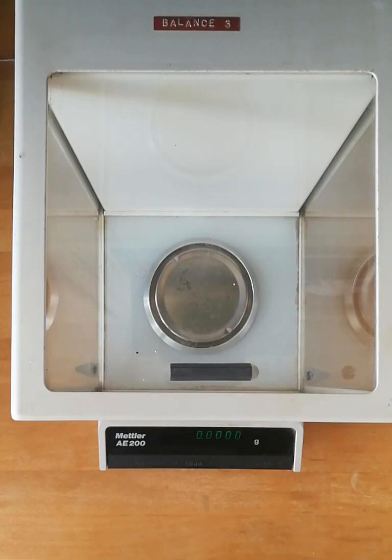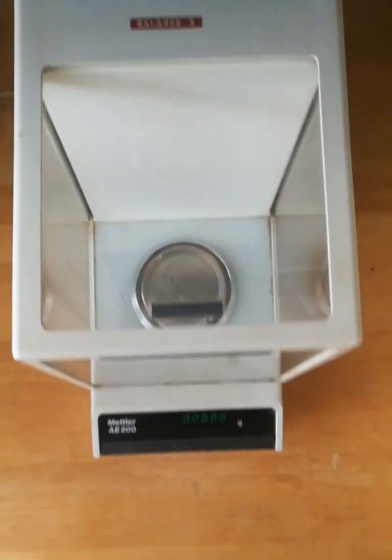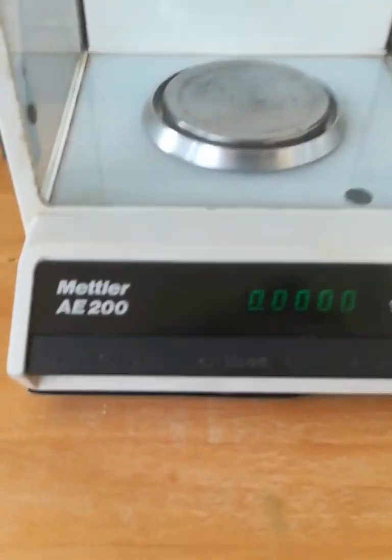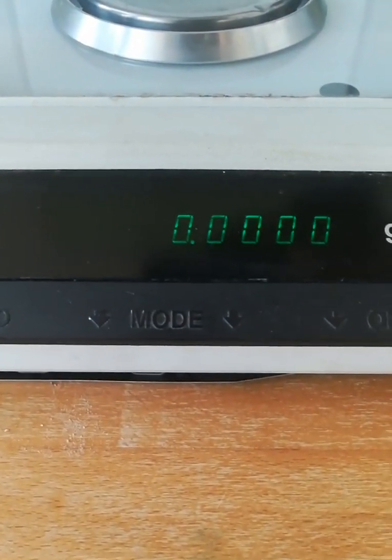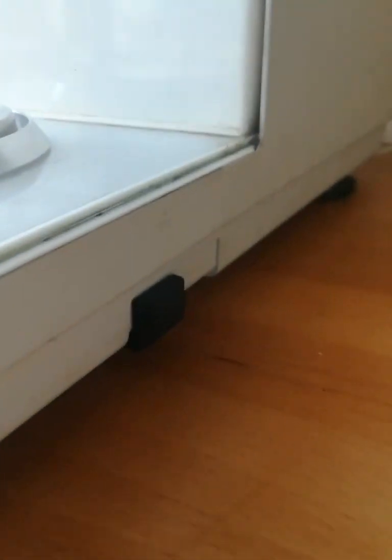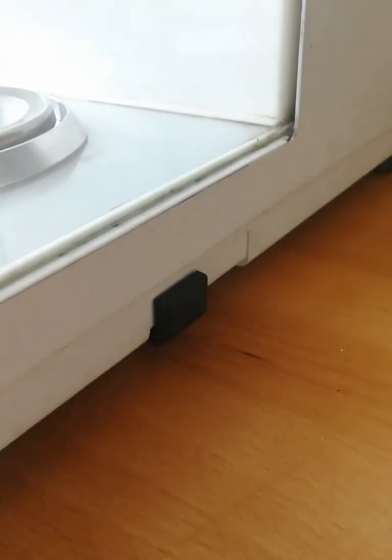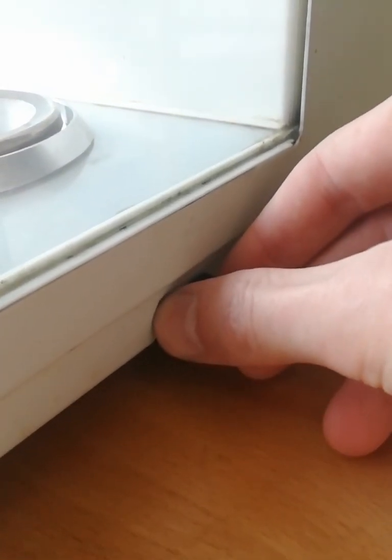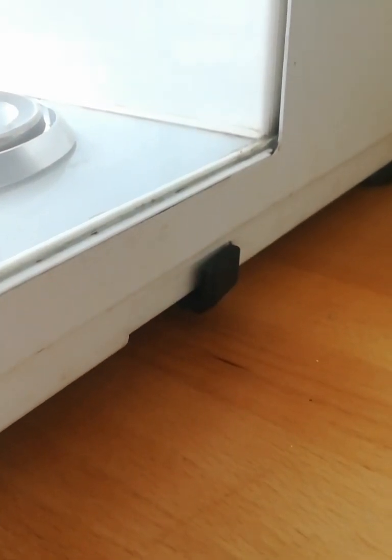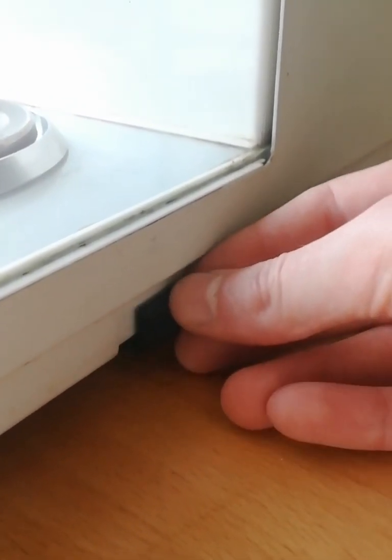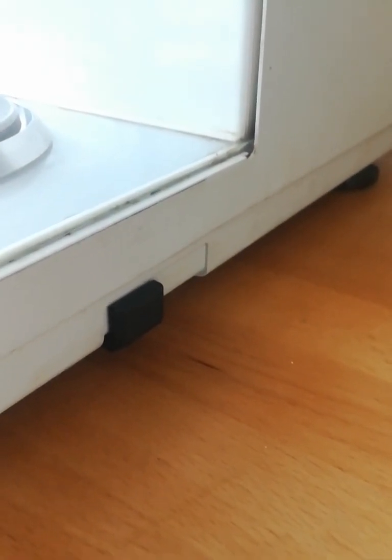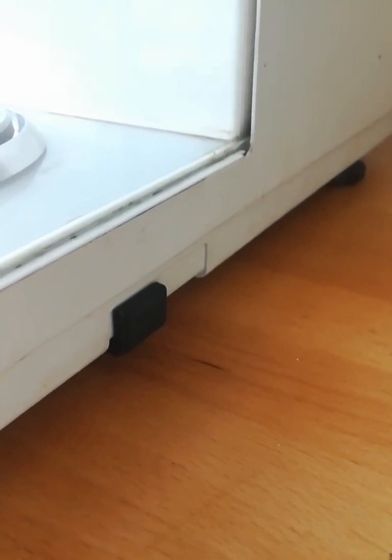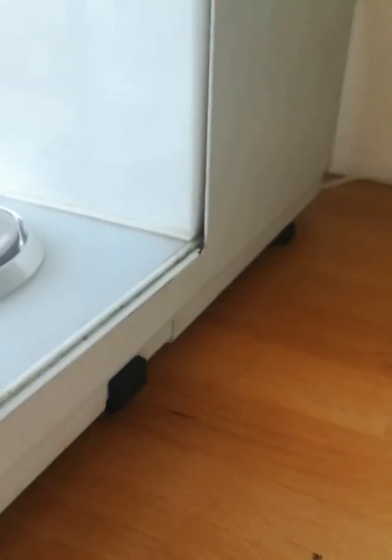I think that's everything. I will just show you the parts that we've been looking at. You can see here the zero, mode, and on-off buttons, and the lever on the side. When it's backwards it's in the hundred-gram position, and when it's forwards it's locked out of the mechanism and somewhat protected from damage as well in that position. You should always keep it in the forward position when it's in storage.